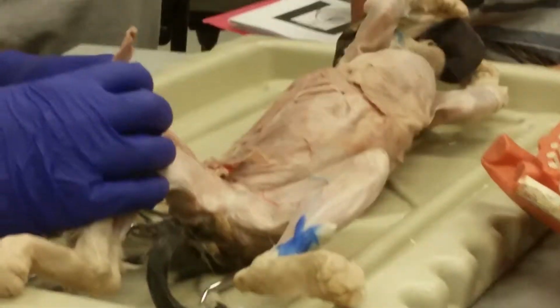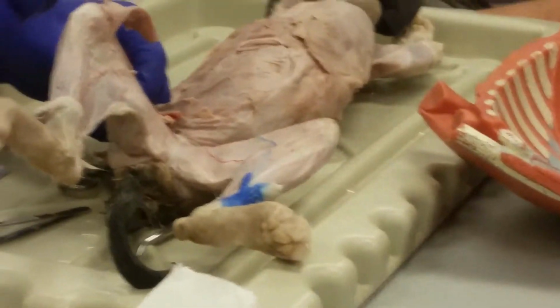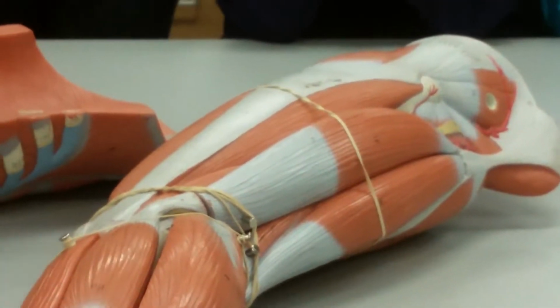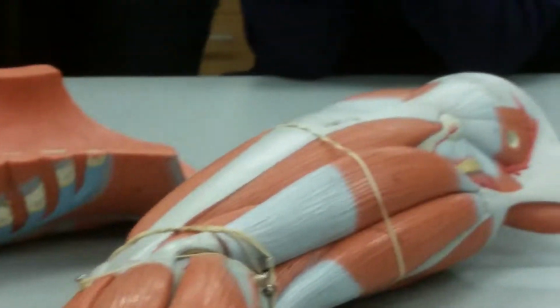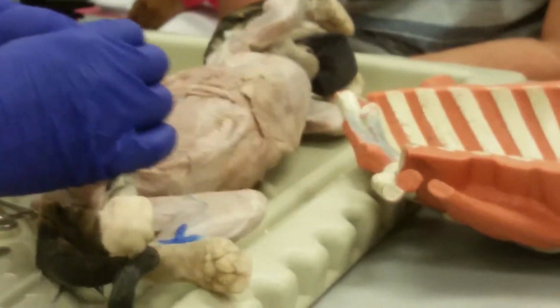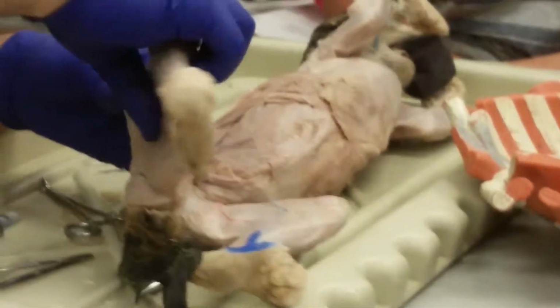All right, now there's a muscle here that's not on your list. Can you turn that leg over? Slide it towards me a little bit. It's a muscle high up here on the hip that goes into this long fascia that goes down the side and basically compresses the side of the leg. Called the tensor fascia latae. It's not on your list, but you can see this big wide fascia here that it originates from. I just have to get it out of the way to show you these other muscles, so I just want to point it out.